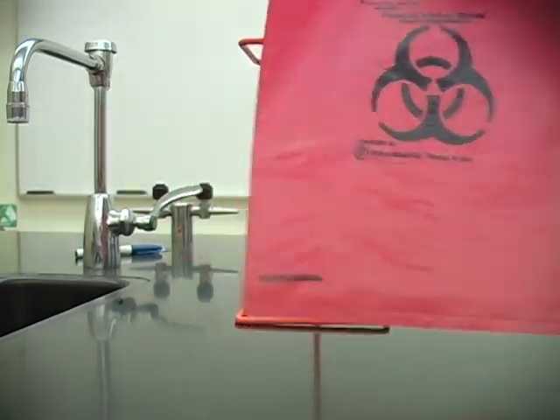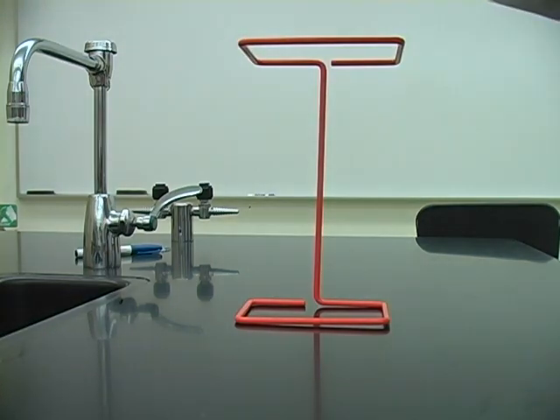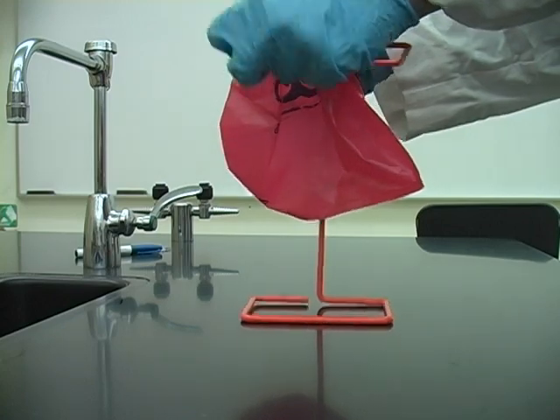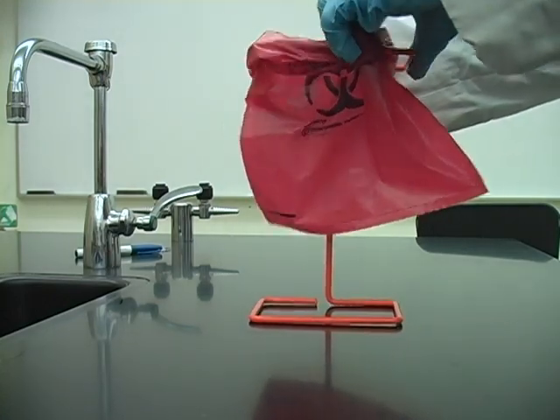So that the bag's contents don't spill out and contaminate your work area, be sure to wrap the top of the autoclave bag over the top of the autoclave bag stand, like I'm struggling to do in this video.